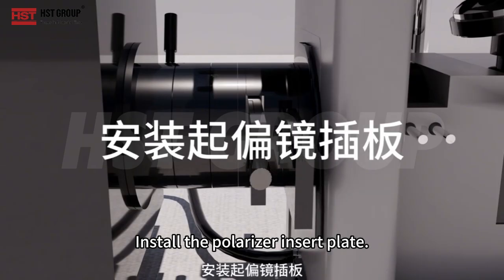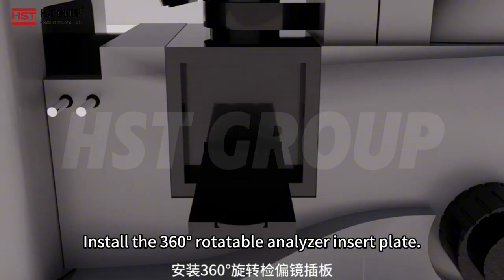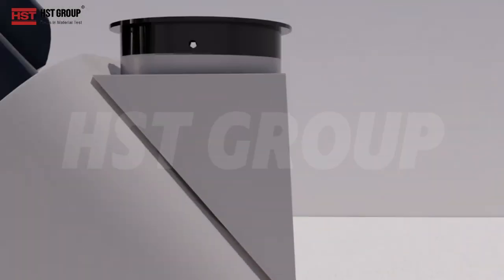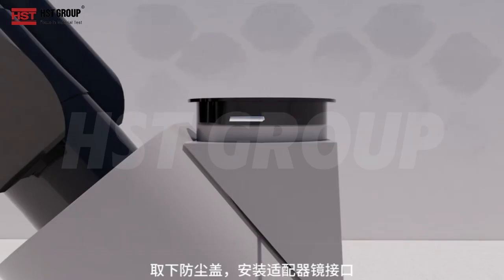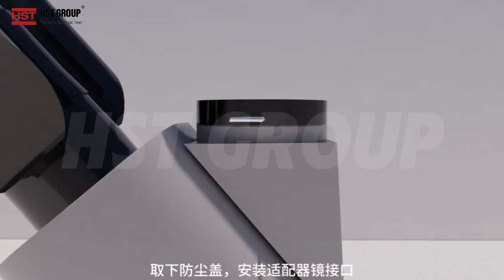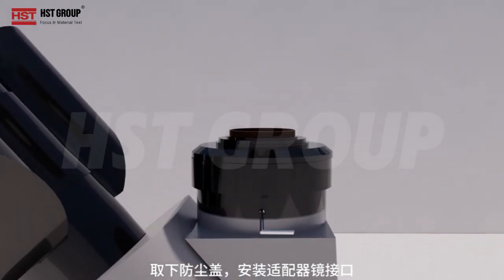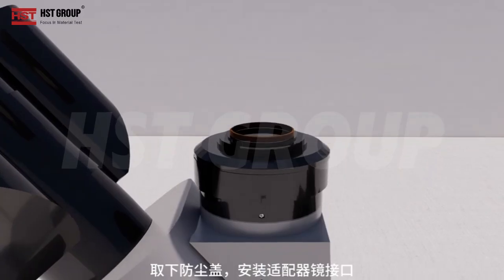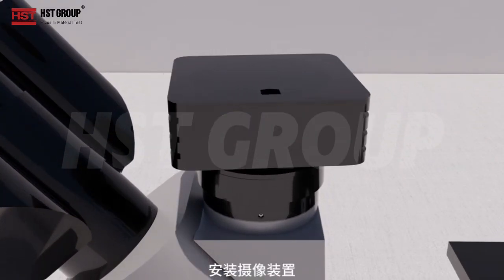Install the polarizer insert plate. Install the 360 rotatable analyzer insert plate. Remove the dust cover and install the adapter interface. Install the camera device.